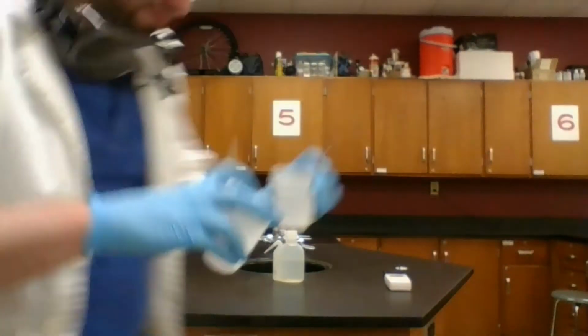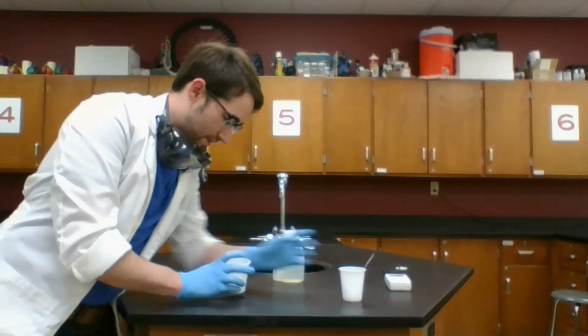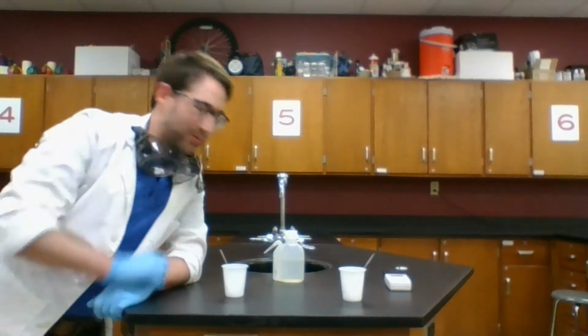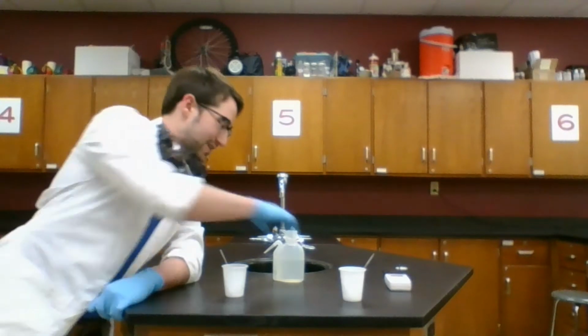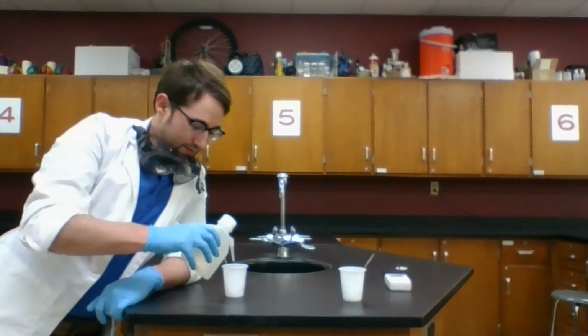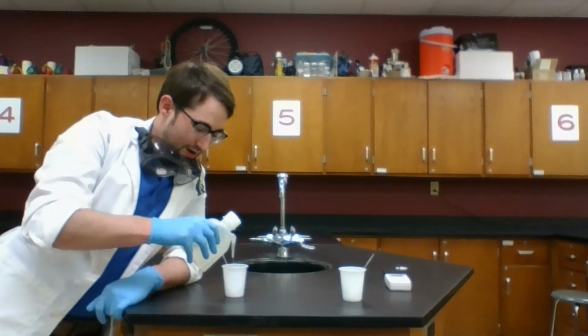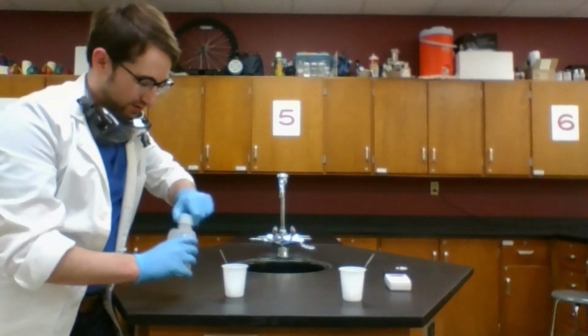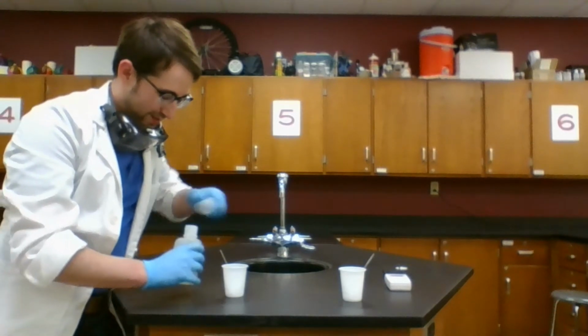All right, we'll go through these one at a time, but I'm going to start both of these because they take a little while to get going. So I'm just going to mix some water in with these. Doesn't really matter how much. Just want to have enough to get it dissolved. Speed this up a little bit.